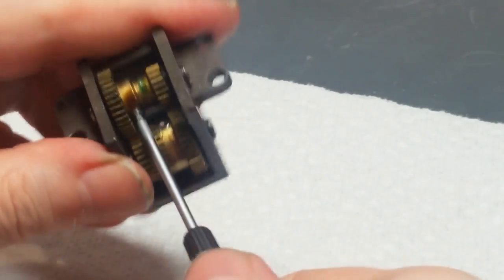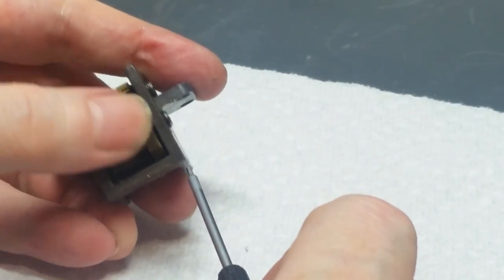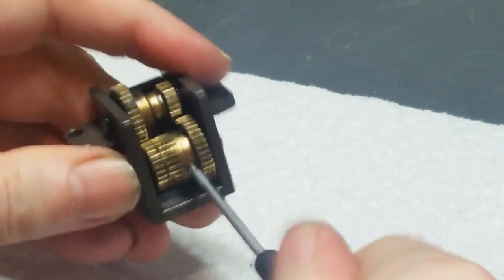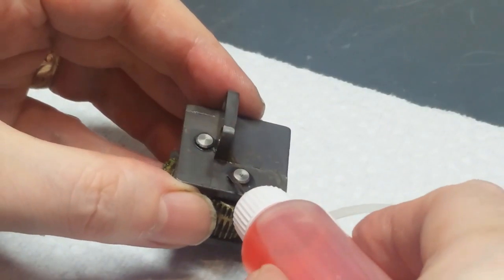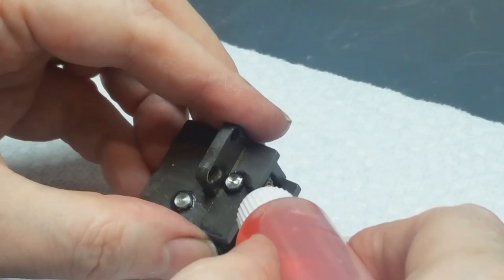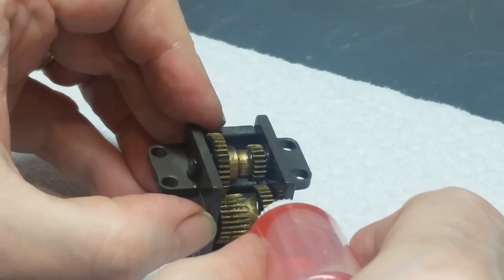I've got a 1.3 millimeter hex tool here, and I'm going to loosen up these set screws. There's one on each gear holding them to these two shafts, so I'm going to loosen these up. Next step is to push these shafts out so that I can get the gears out, and then at that point the whole thing comes apart and we can clean it up and put it back together. Now, my go-to lately has been Kroil penetrating oil. I'm going to put that on the ends of the shafts. And I might even drip a little bit down inside here.